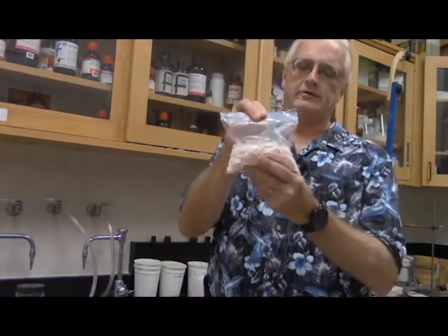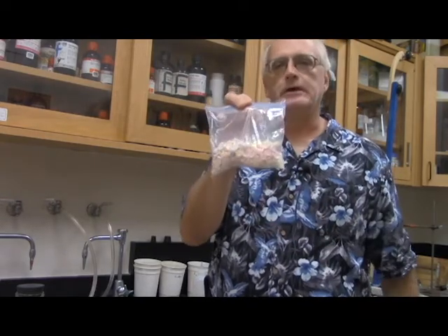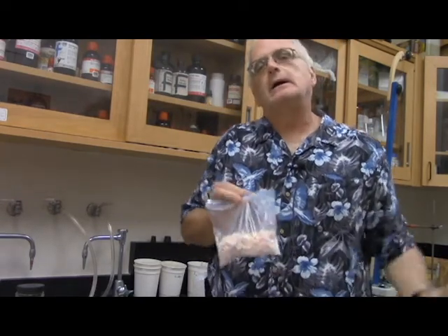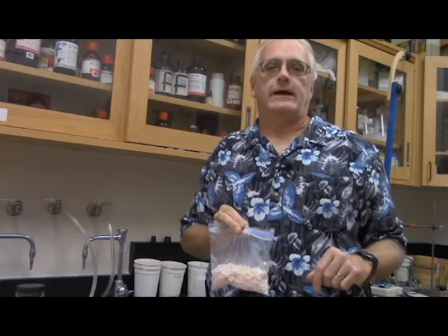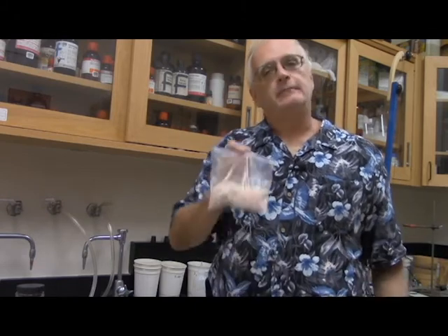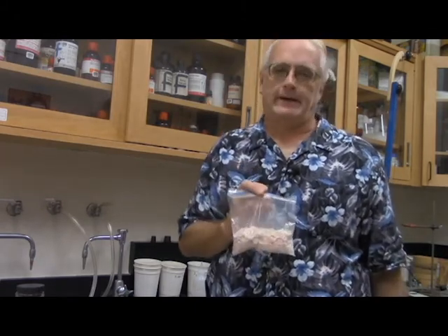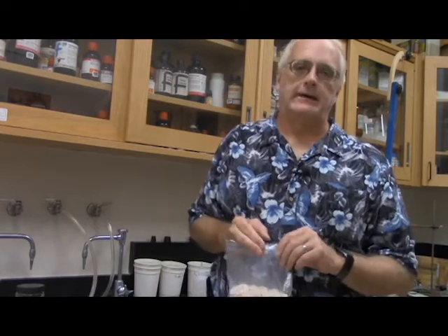And I like to illustrate the point by basically saying, how many Smarties are in this bag? There's a bunch of candies in here, how many are in here? I am going to actually have them count them all up, but first we're going to start weighing things. So let's go over to the good scale and start working on that.